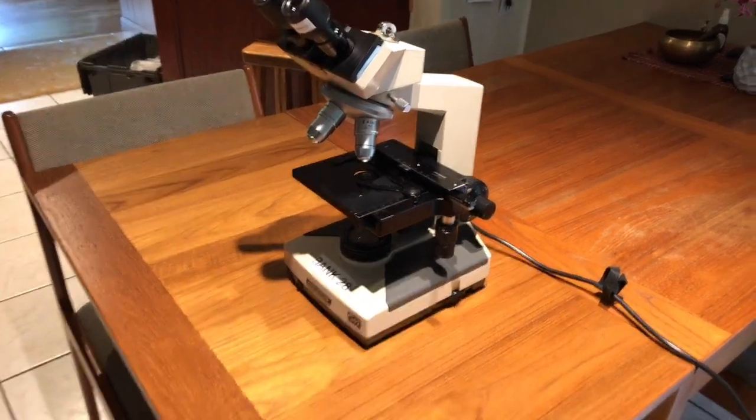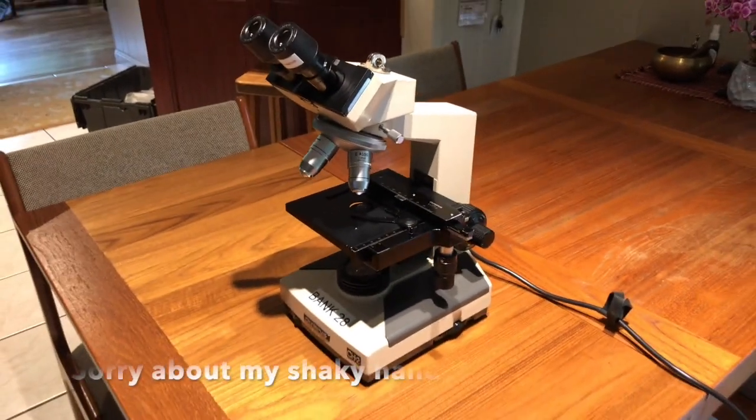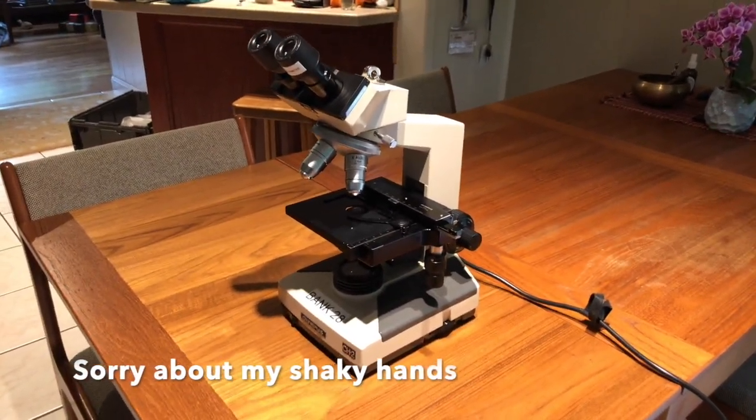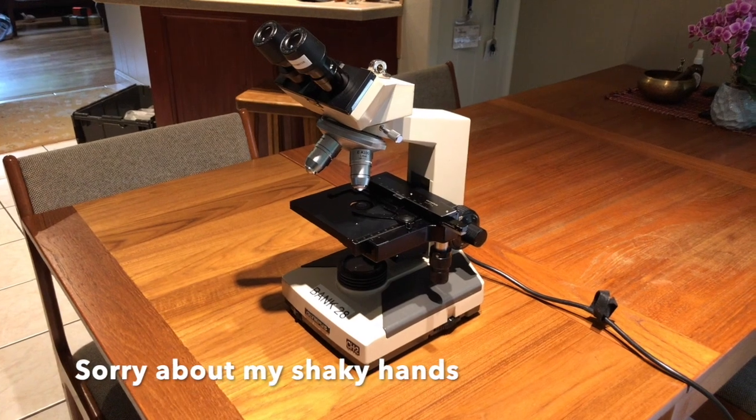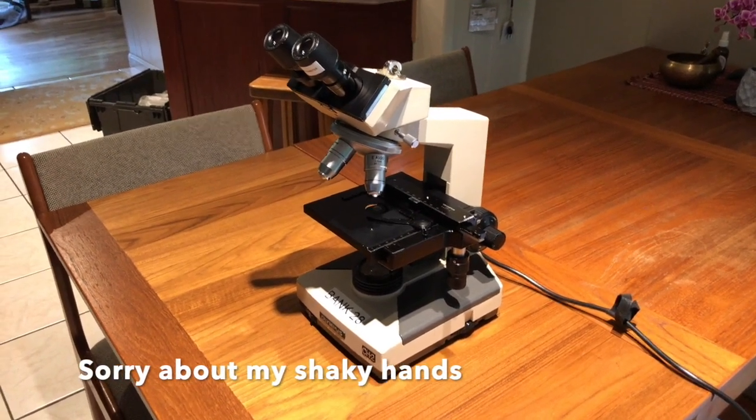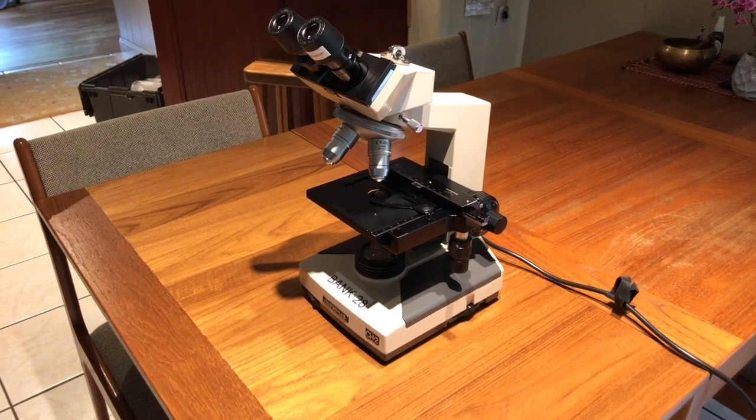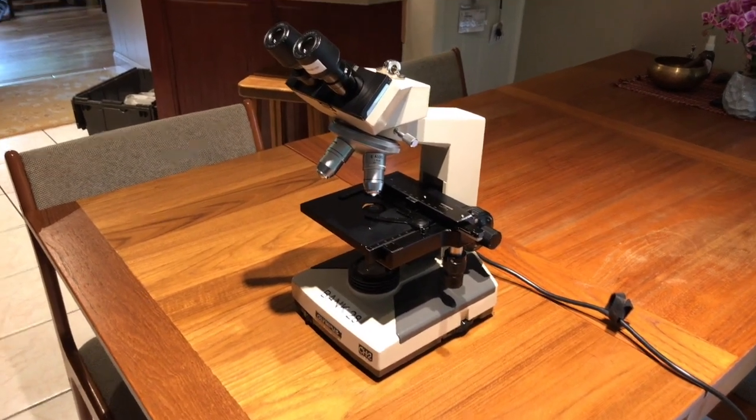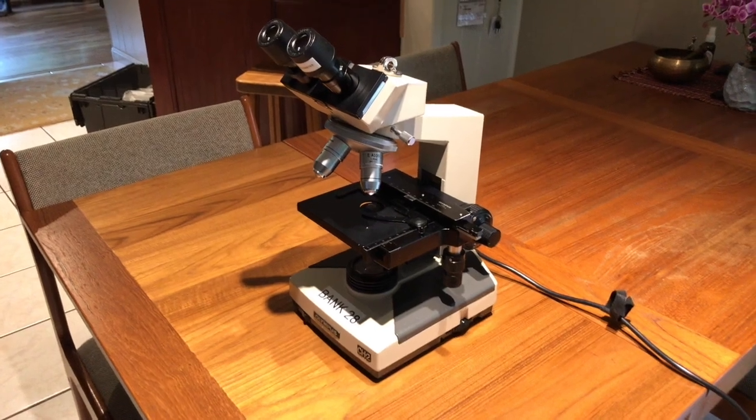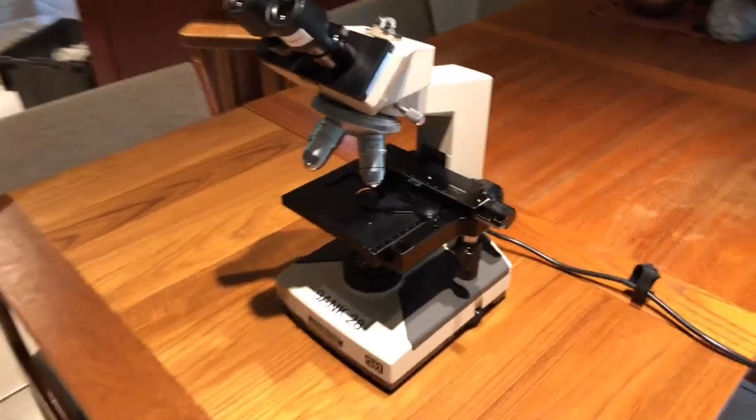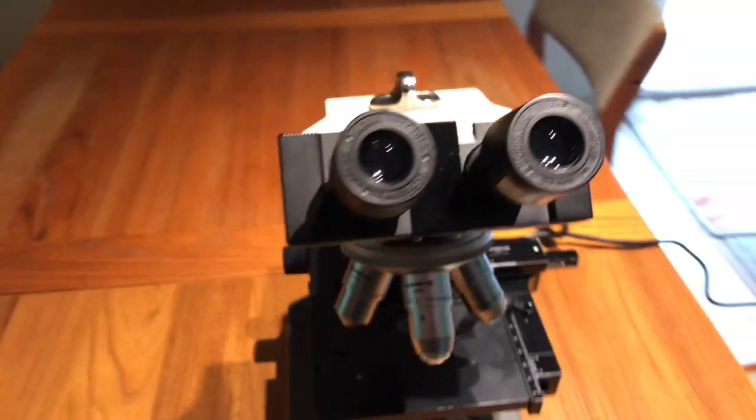On Thursday I'm only going to be doing the videos for the compound microscope like this one, because the dissecting scopes are fairly easy to learn and we'll probably just give you some quick instructions in lab.